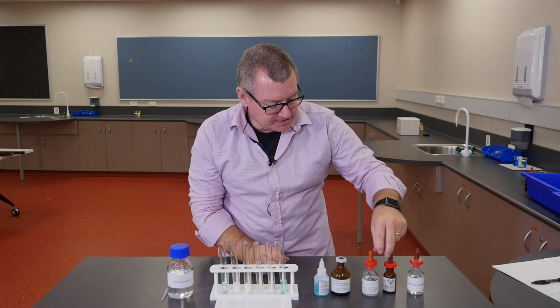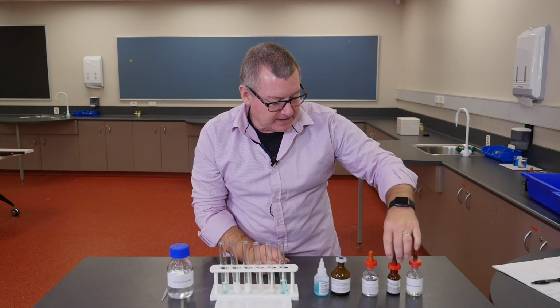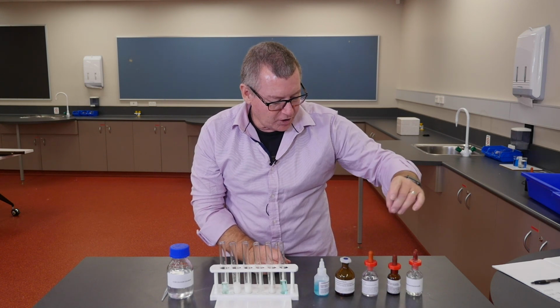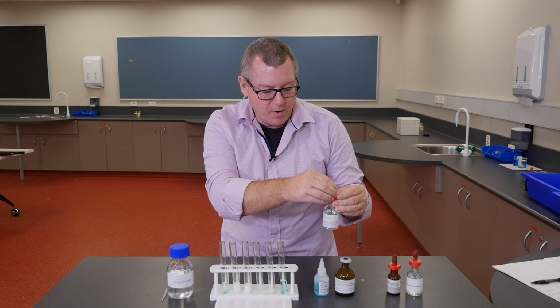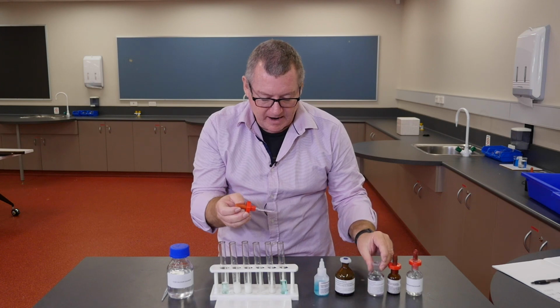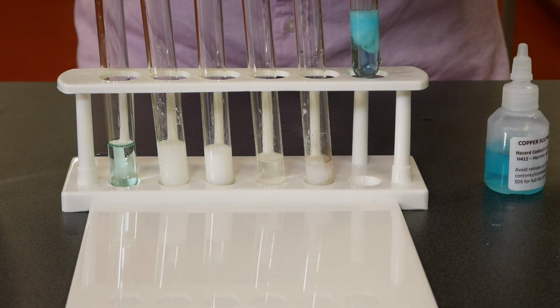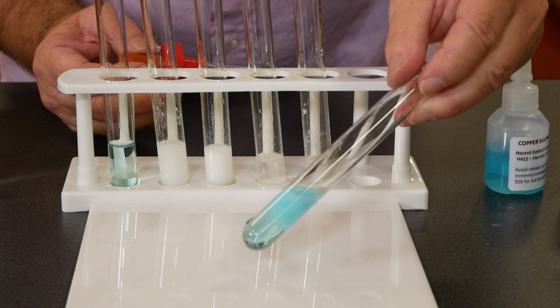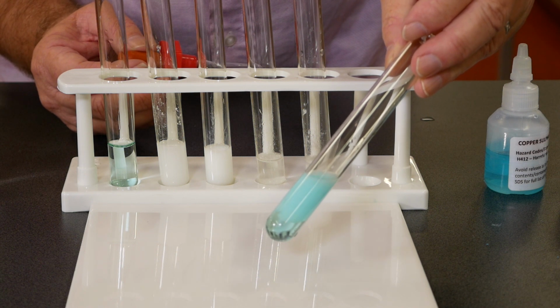So, which of these do we think is the most likely? It's not going to be one of the nitrates because we know that the nitrates are soluble. So let's give it a shot with the ammonium oxalate. What we hope is that our ammonium sulfate, we know is already soluble, but our copper oxalate does indeed give us a bluish precipitate. So you can see the blue colour. It's a cloudy, milky blue, but there's definitely a blue precipitate there of copper oxalate in that last one.